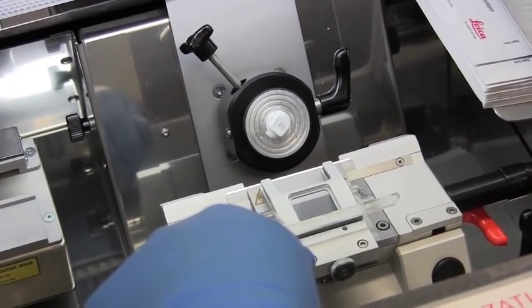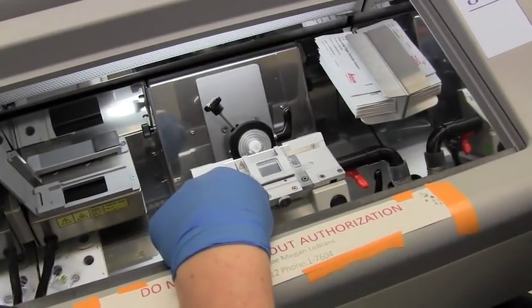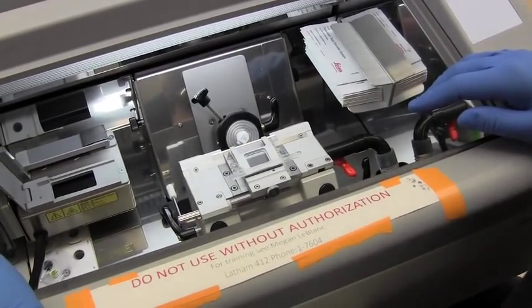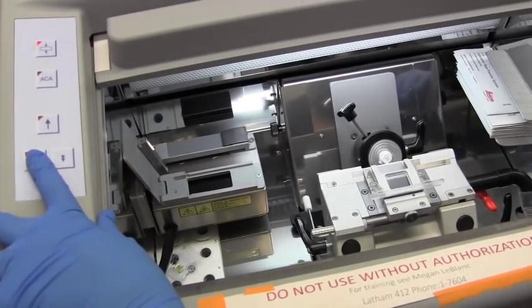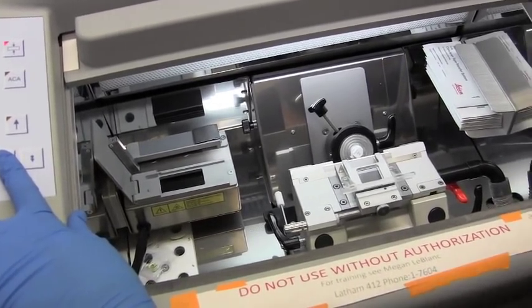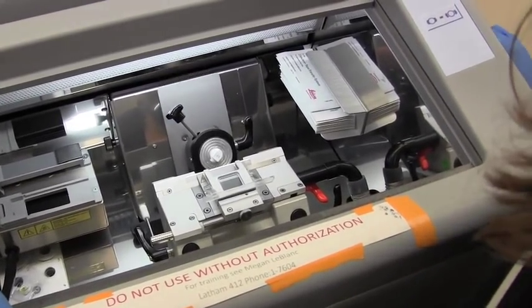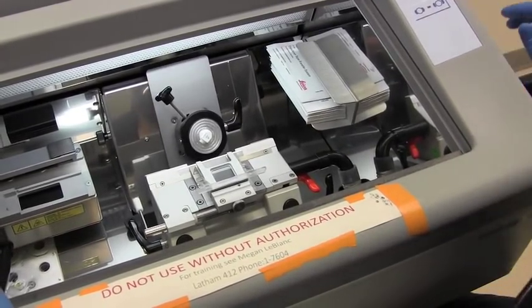Now I like to release the wheel and bring it close to the blade so you have a point of reference. And then advance it using the buttons on the left. Since it looks like you have it pretty close, and start cutting.